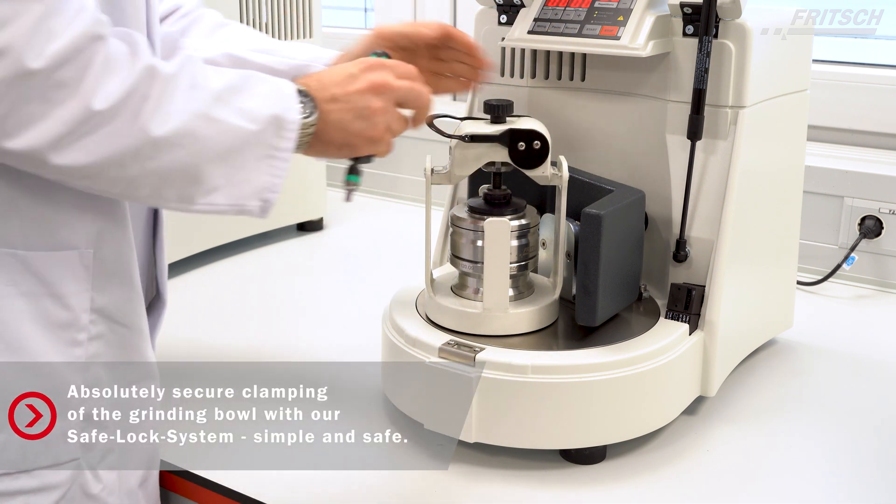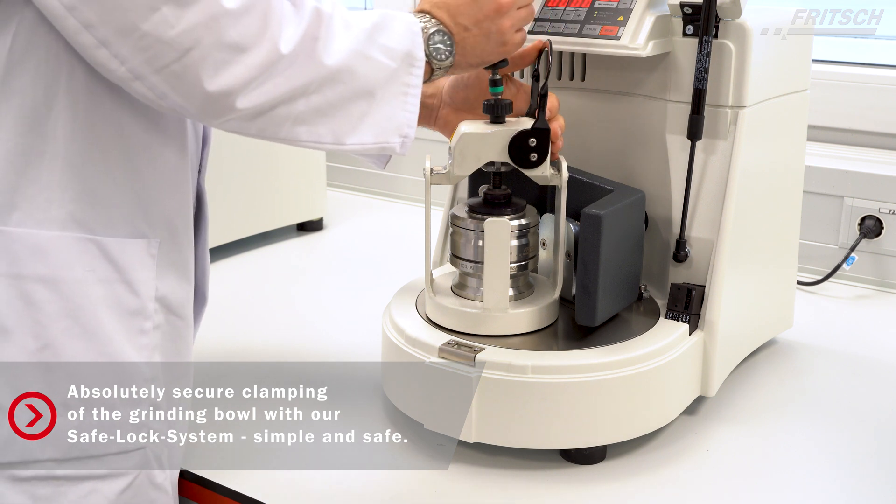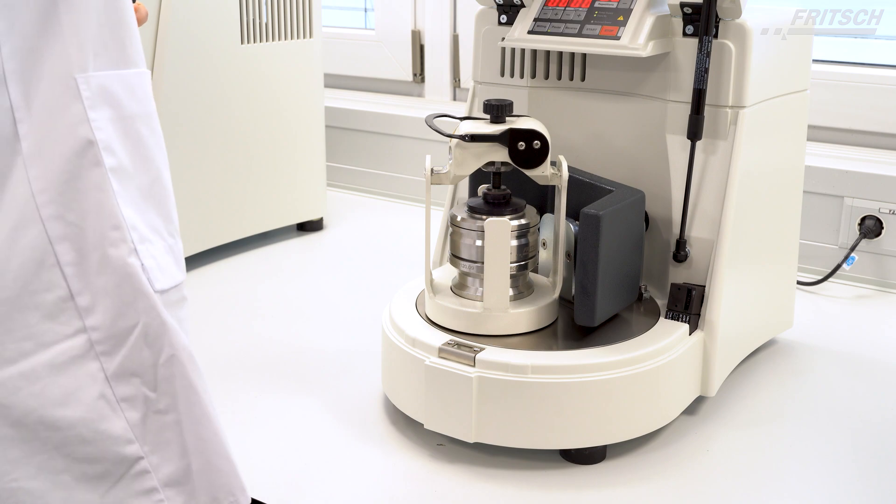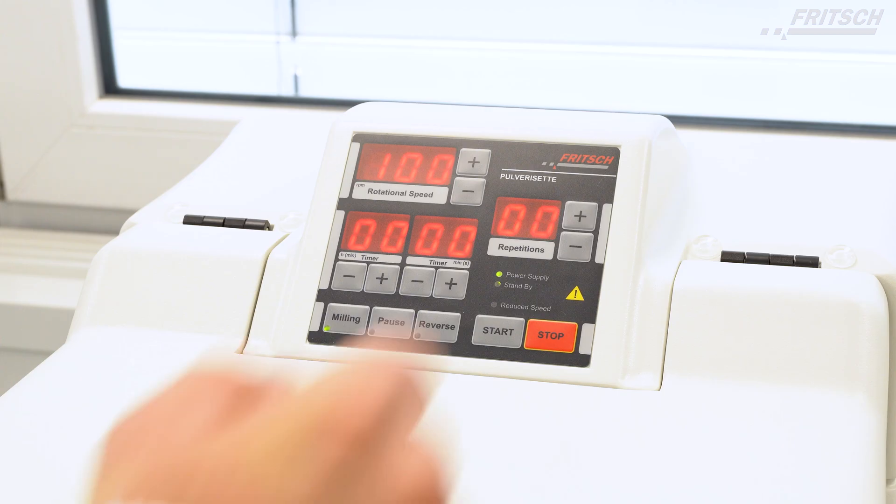Clamp the grinding bowls with our easy-to-handle SafeLock system. For further information, check out our video on how to close the SafeLock system or feel free to read the operating manual.